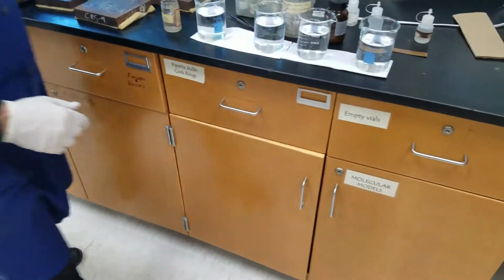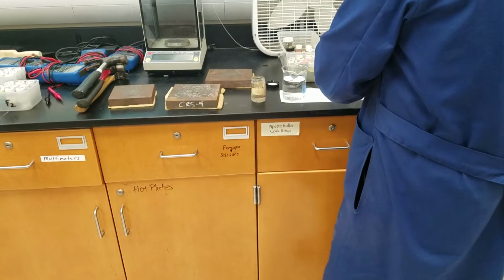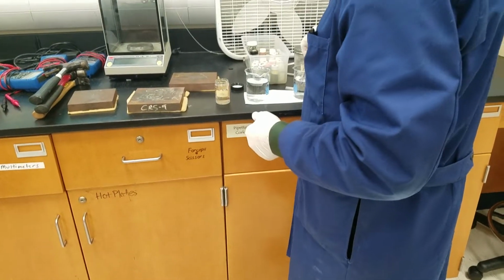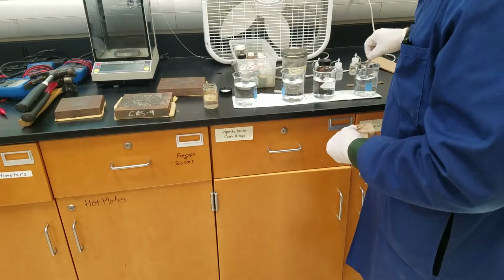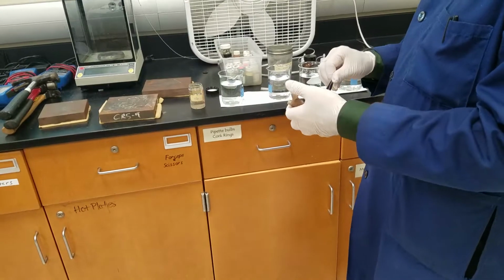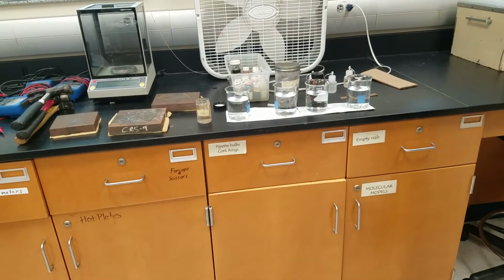What I'm going to do is to put in some phenolphthalein into each of these beakers. When did you use phenolphthalein? For titrating. Good. So your group 1 metals, what are they called? Alkali. Why do they call them alkali metals? Because they're a base. Because they react with water to produce a basic solution. Their oxides react with water to produce basic solutions. So the color change you are going to see is because of that basic nature. Morgan, you want to tap it into that first beaker, please?